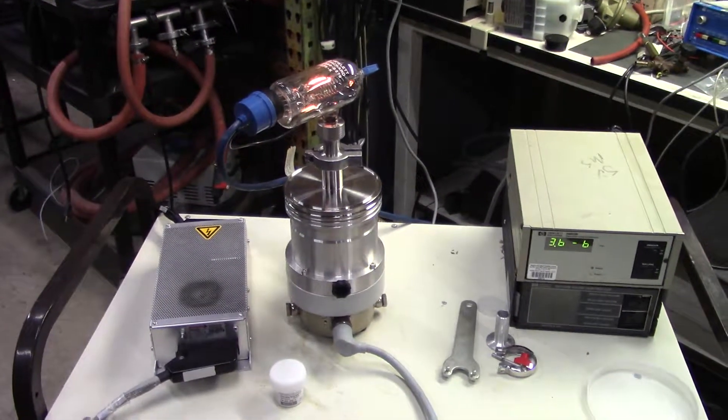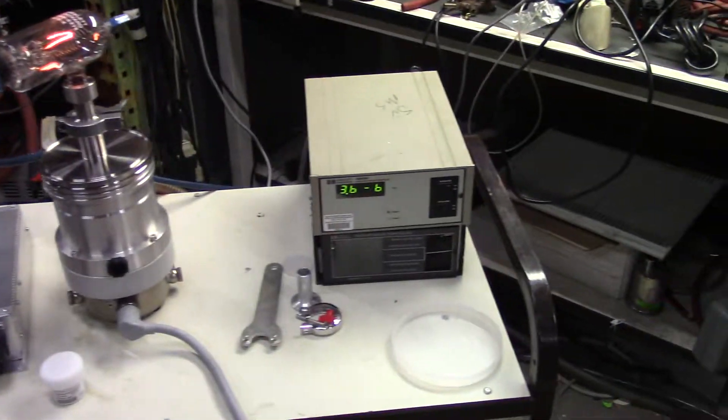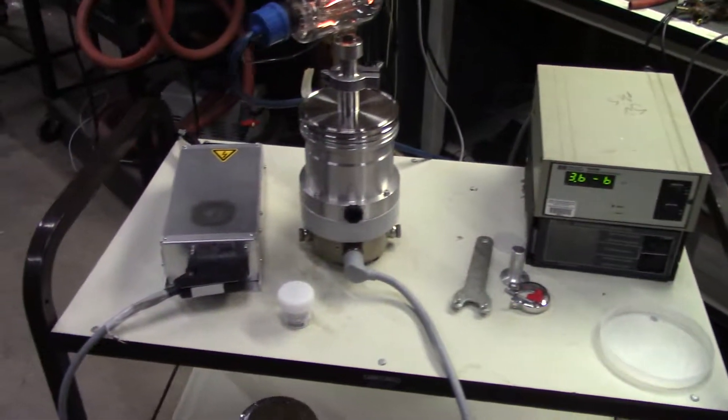As you can see, we have pumped this thing down and we've got an ion gauge hooked up to it, and it's pumping in the low 10 to minus 6 range. It's only been pumping for a couple minutes.